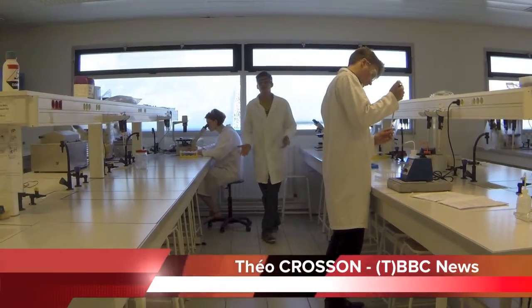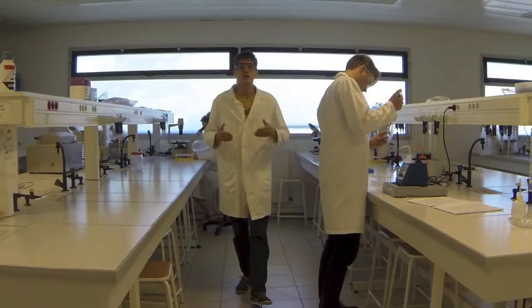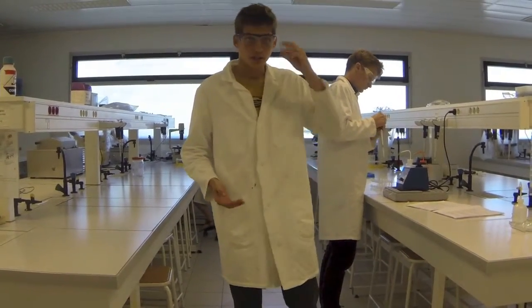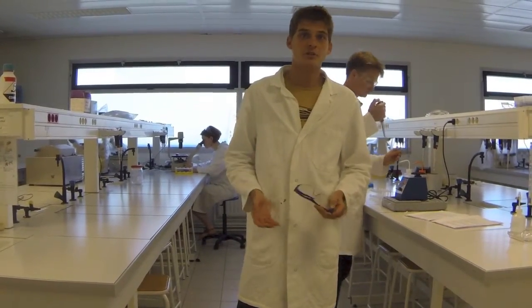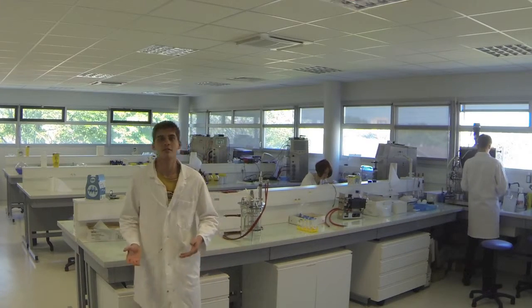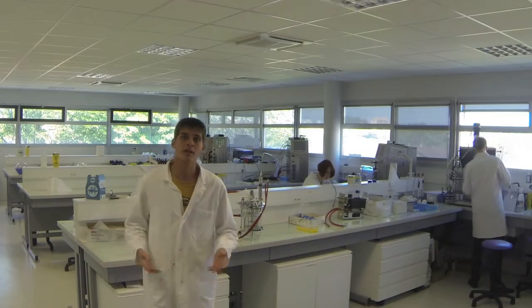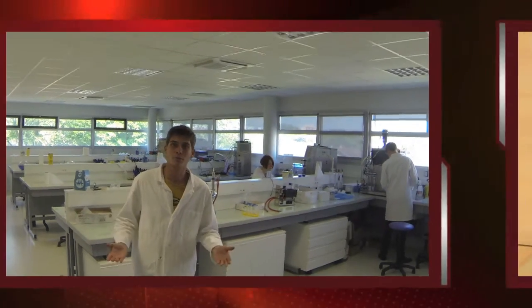Biotechnological processes are divided in three major steps. The first one is cloning, which consists in inserting a gene in a microorganism. Thanks to this gene, the cells will produce a protein which can be used as the major component of a medicine. The second step is the culture of the microorganism in bioreactor to produce the protein in high concentration in the growth medium. This is the upstream processing, or USP.